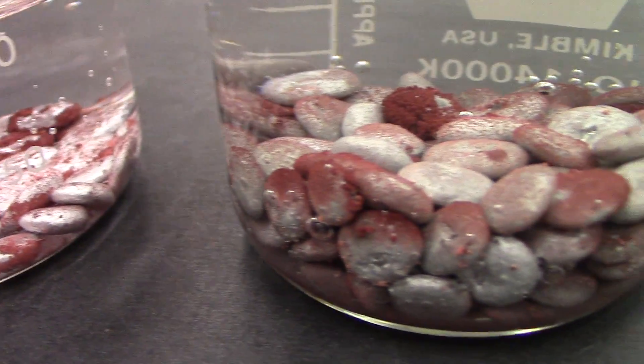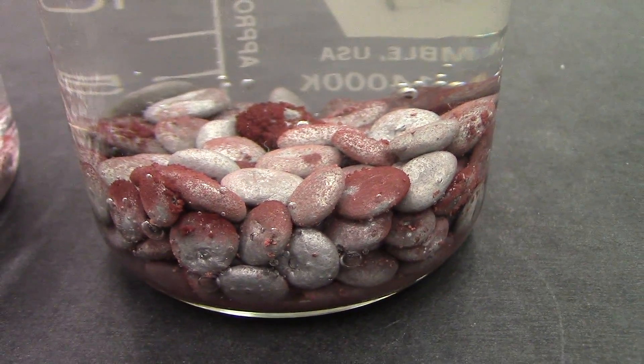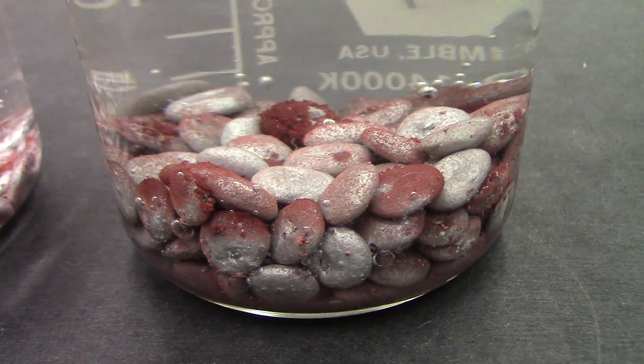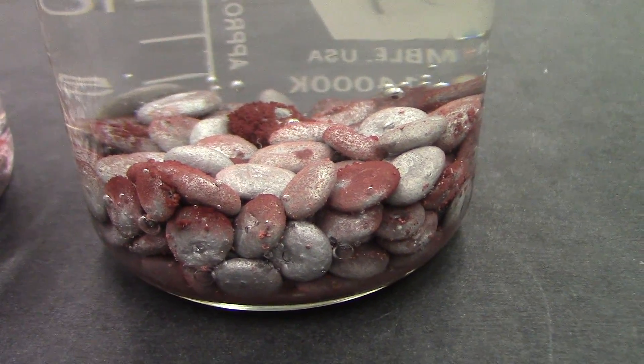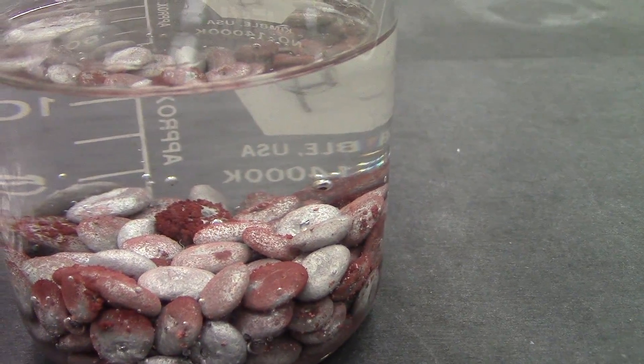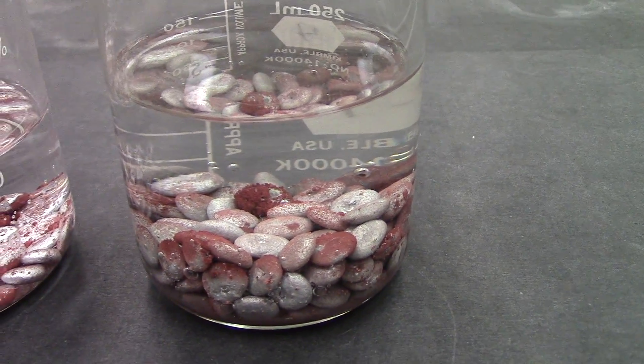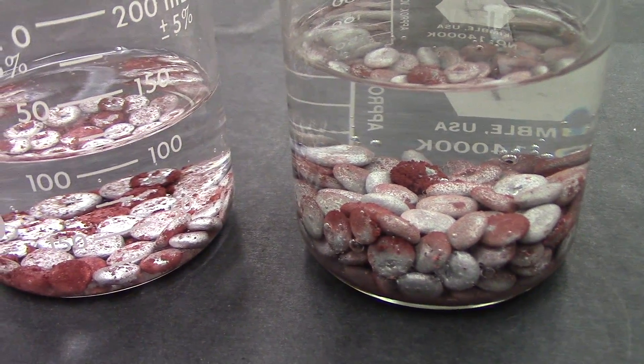The other one, 72 hours in, has gone quite a bit of the way. We can see plenty of copper being deposited on the aluminum pellets down at the bottom, and the solution above looks pretty clear unless you compare it to the one that's next to it.